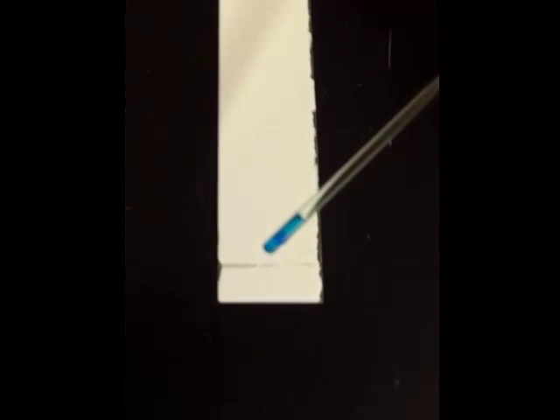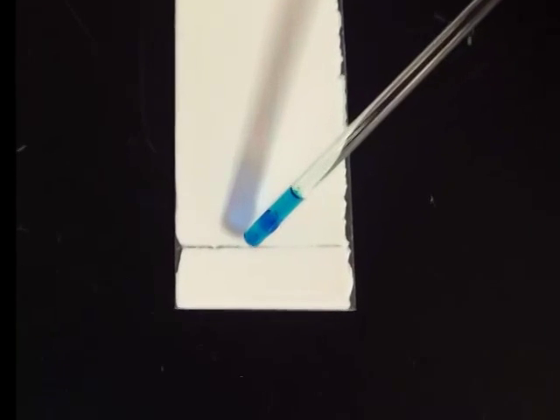I still have my finger on the capillary tube. I never take it off. I'm going to find the center of that line and gently touch, not taking my finger off. There's my first drop. You can blow on it if you want to help it dry. It's got acetone so it will evaporate rather quickly. I still have my finger on the end of the tube.